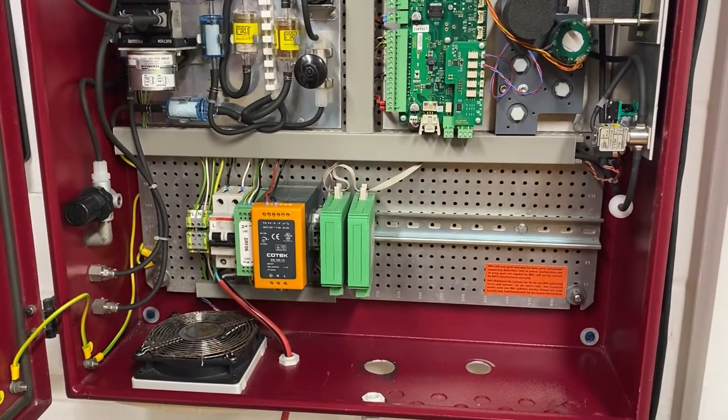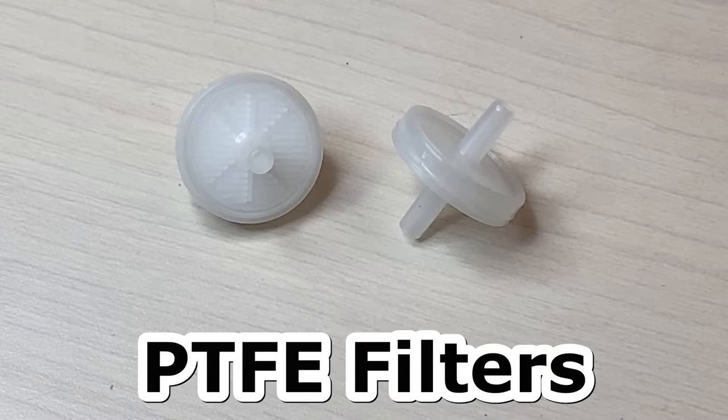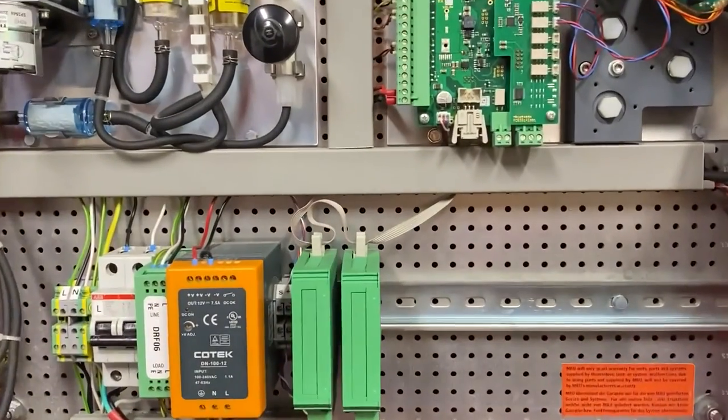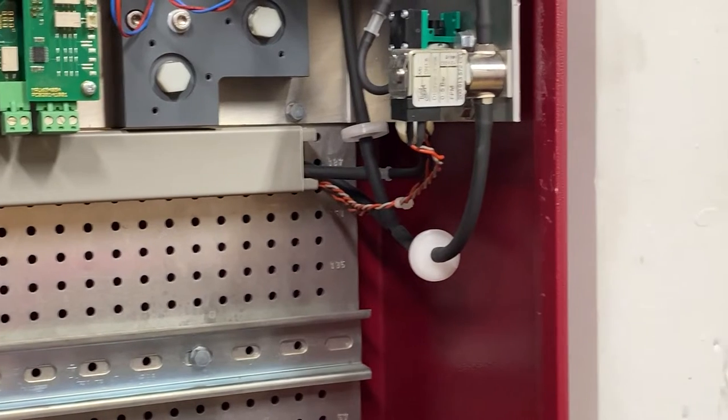In this video we'll be talking about the PTFE filters, otherwise known as the moisture trap filters. You can find both of them hanging directly right of center within the device.